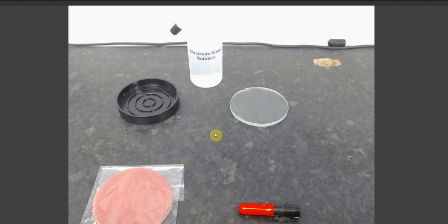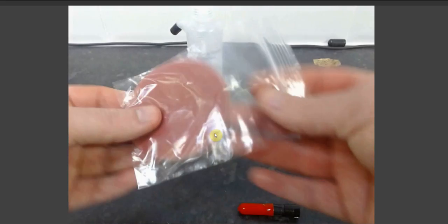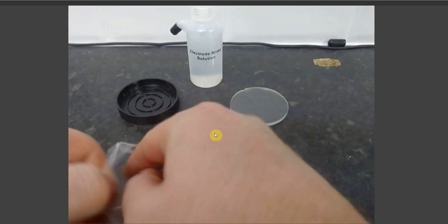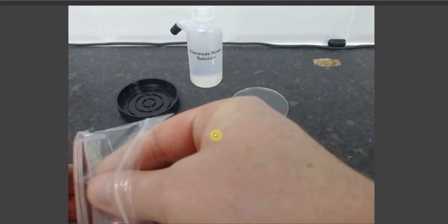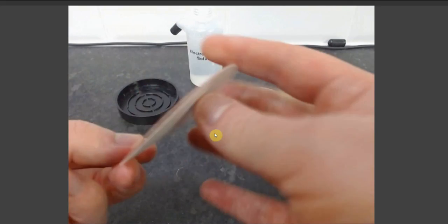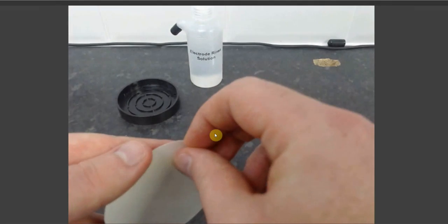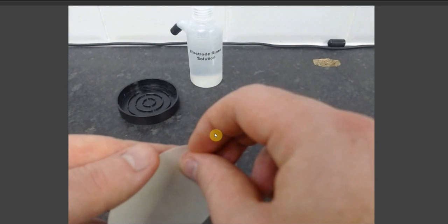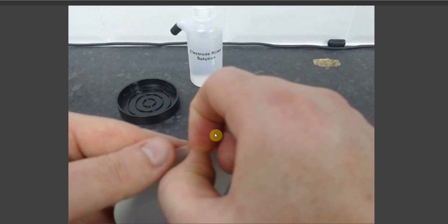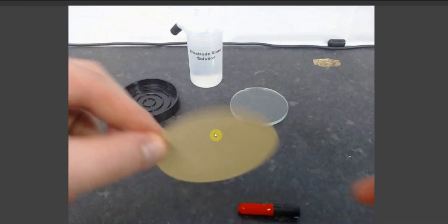The process of polishing is as follows. Take your pack of polishing pads and remove from the film packet. Turn over, and each polishing pad has an adhesive back which can be exposed by peeling away the paper film on the back of the polishing pad.